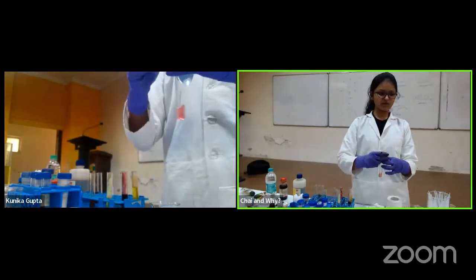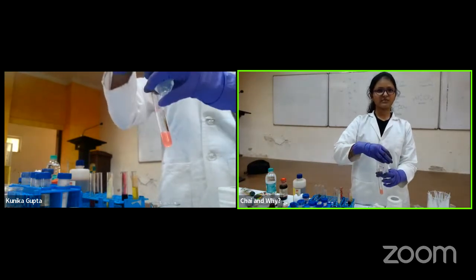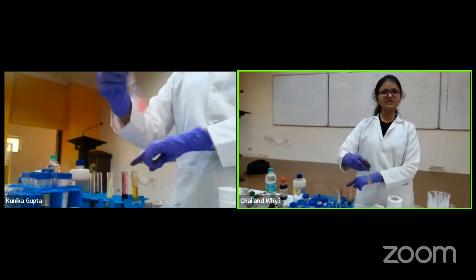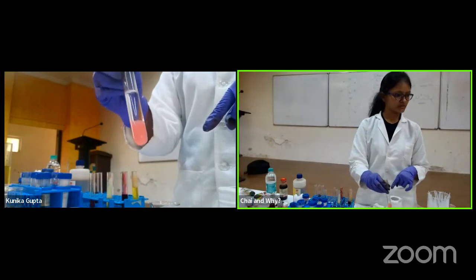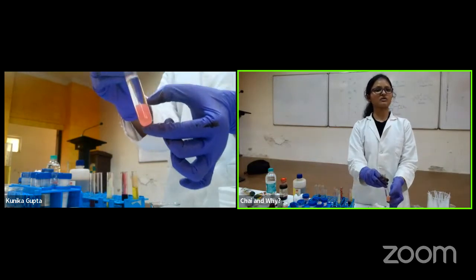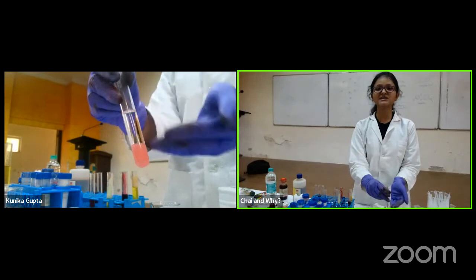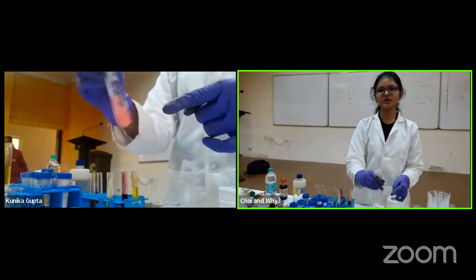So it is actually not mixing. I showed before that this is not mixing, but now I am benefiting from this. Okay. So how? Because I know that from this mixture I have something which is water soluble. So this way I can take the water-soluble acids and bases out of it. Okay?